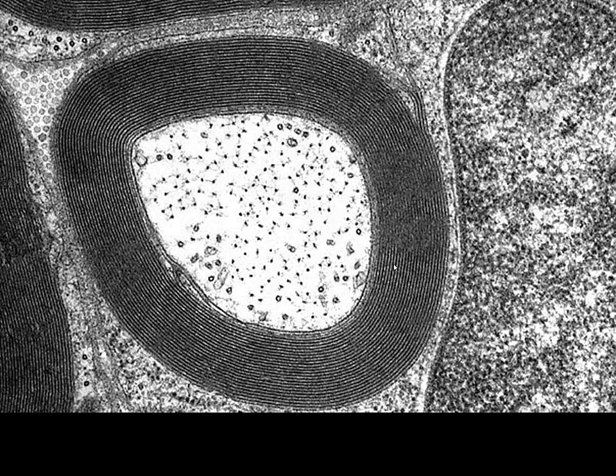Now we can very easily see our major dense lines. Again, the intraperiod lines are very difficult at best to see. And in this particular image, we can see the internal axon. And we can see at this point where we sort of stop and we have these enlarged places, a little bit of cytoplasm. This is our internal mesaxon.